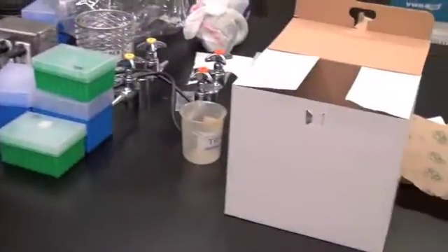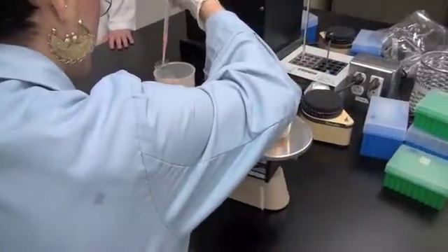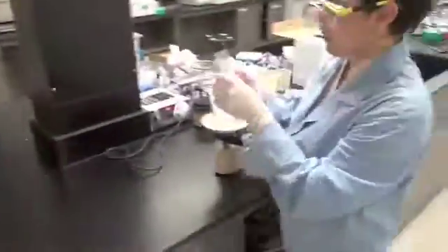Now Biochemist Dicer is ready to balance. It also looks like she did a careful job in pouring her samples to an equivalent level. Oh, she measures with such precision. It's quite easy when you have the samples almost balanced. Look, it's properly labeled. Yes.